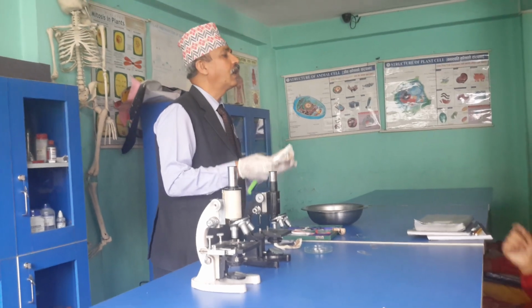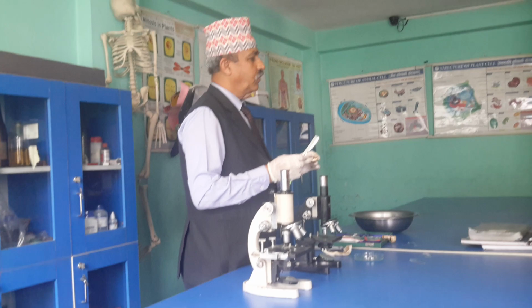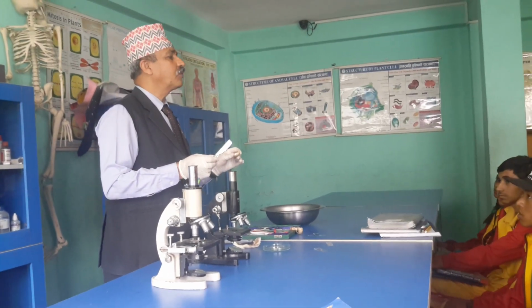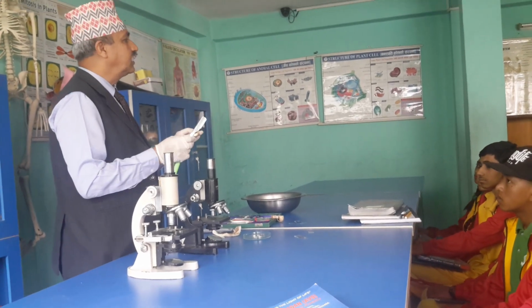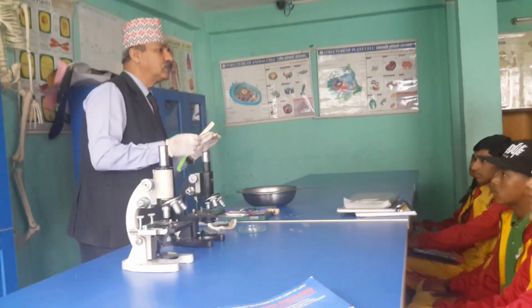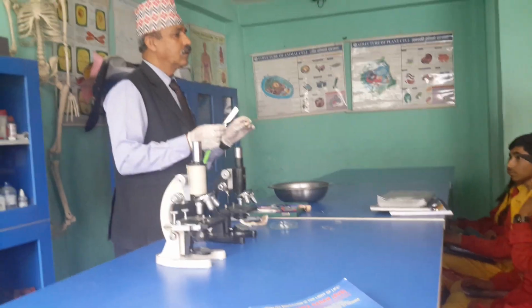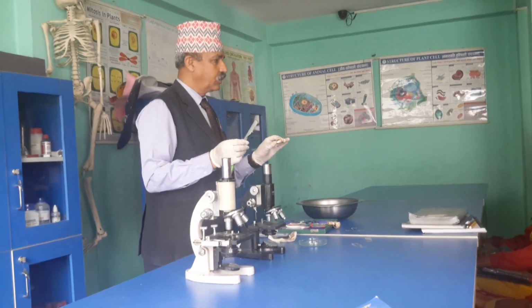Where? In hymenium. Hymenium contains two types of cells. What are they? Basidium and paraphysis. Basidium is singular, basidia is plural. So, basidia or basidium produces basidiospores. How many? Four.